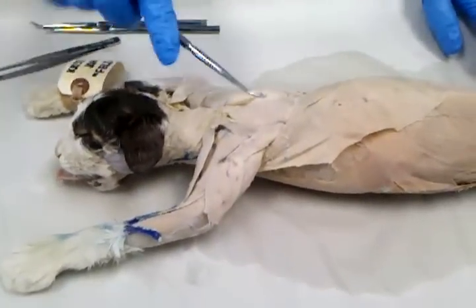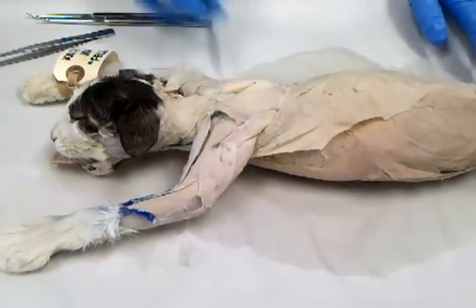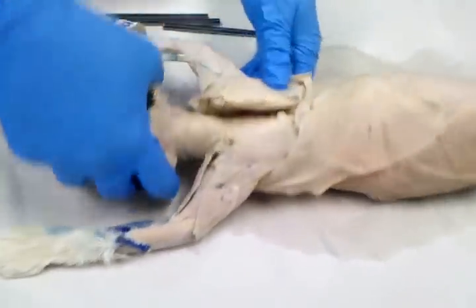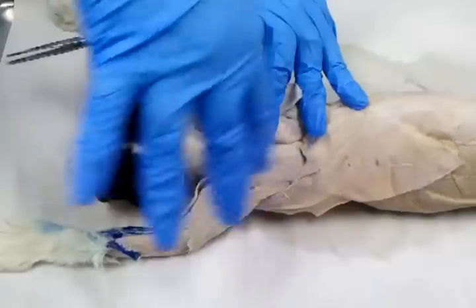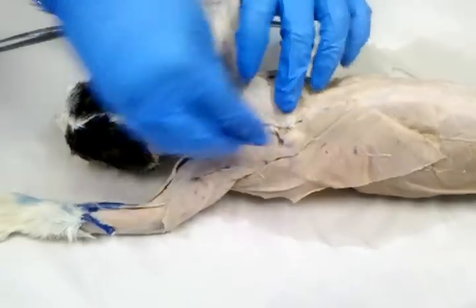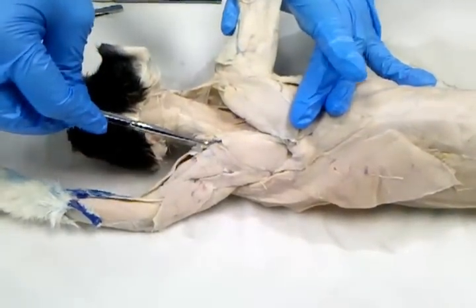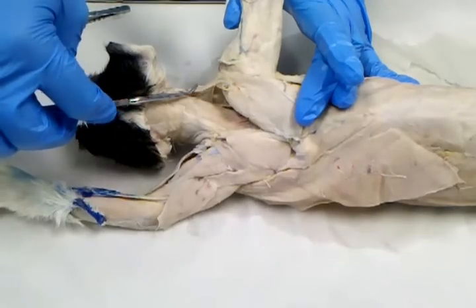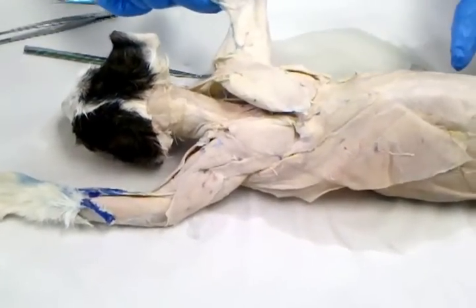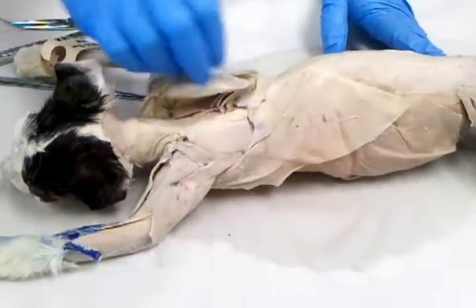Now between the acromiotrapezius and the acromiodeltoid, you have levator scapulae. Just in case they pin one that's been dissected out all the way, what I've done here is I've actually removed the clavotrapezius on the side of the neck, and so that's the acromiotrapezius. What I wanted to show you is that here you're only seeing half of the levator scapulae, because the rest of it runs up into the neck here. So that was superficial back muscles, and now deep back muscles.